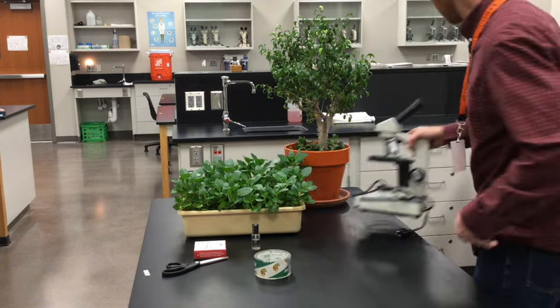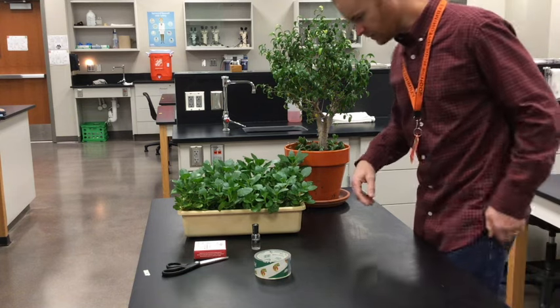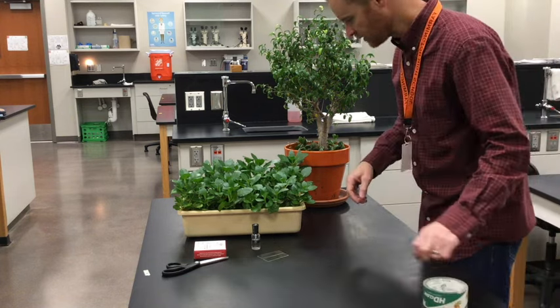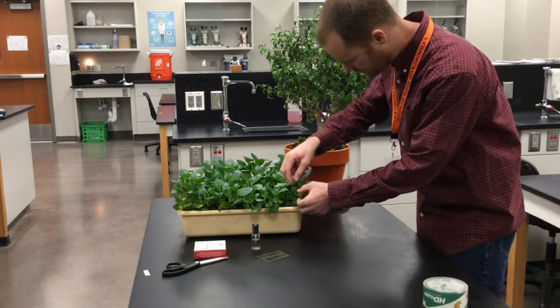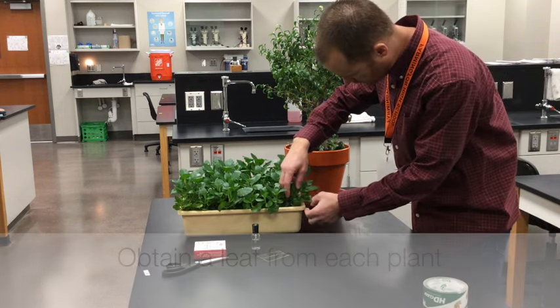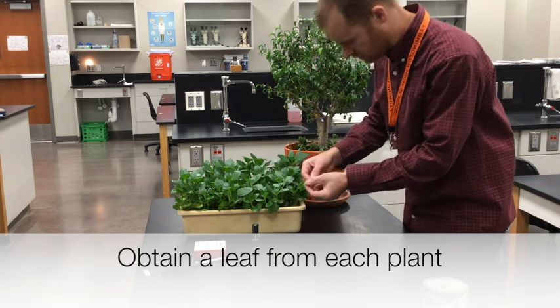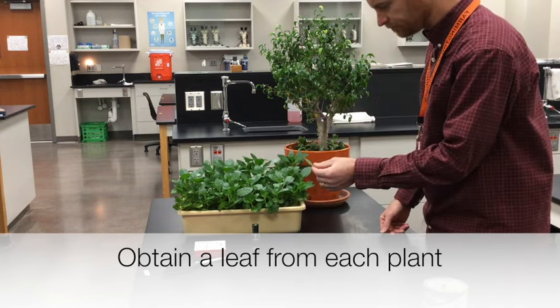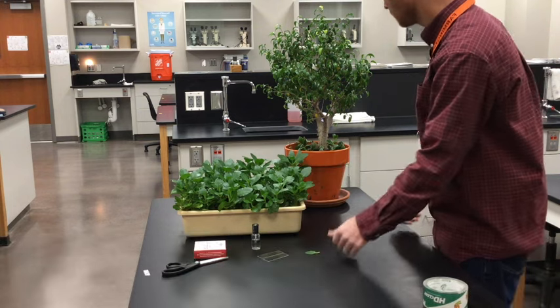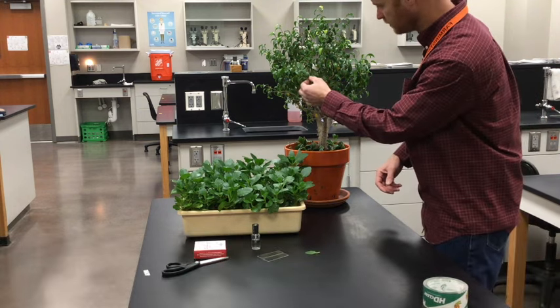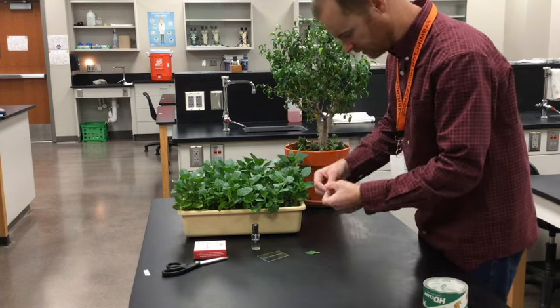Alright, so let's prepare the slides with the leaf stomata. So I'm going to just remove a leaf from the succulent, and I'll remove a leaf from the ficus plant.